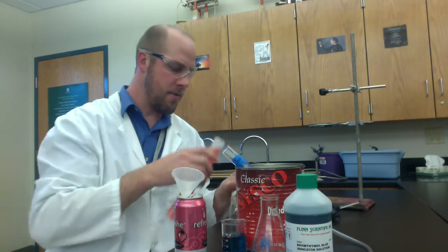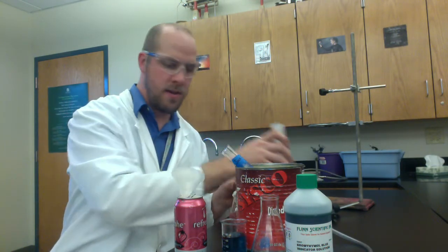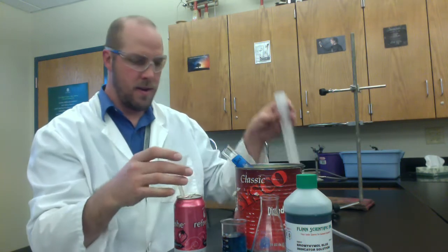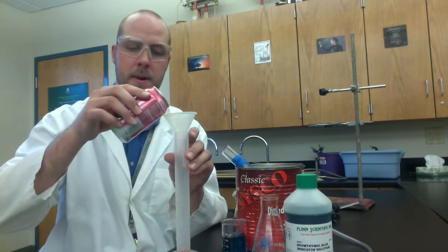So I'm going to add my first amount in there and then I will, like I said with you guys, I'm going to do 200 milliliters.